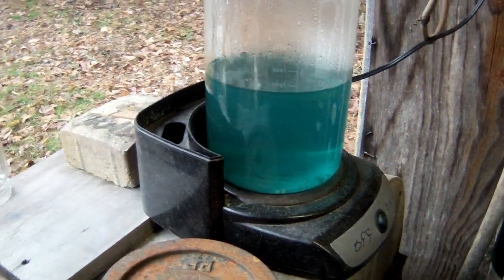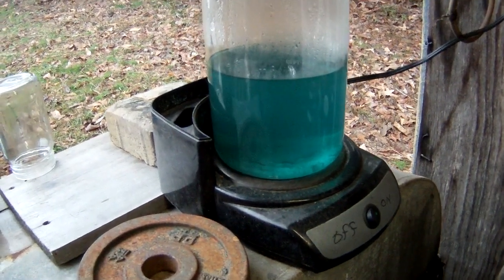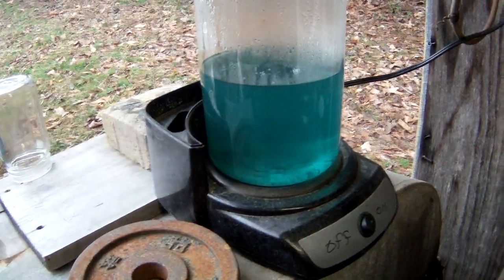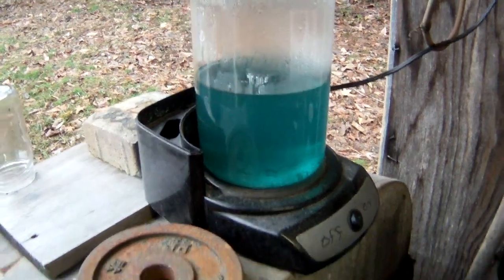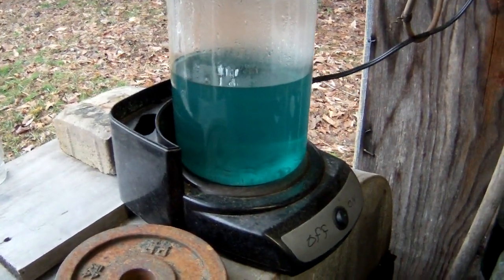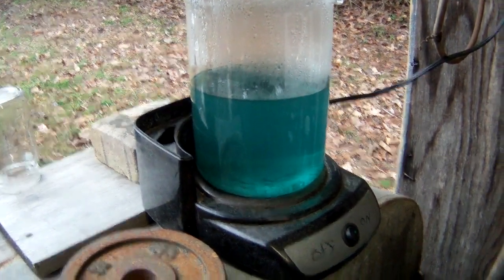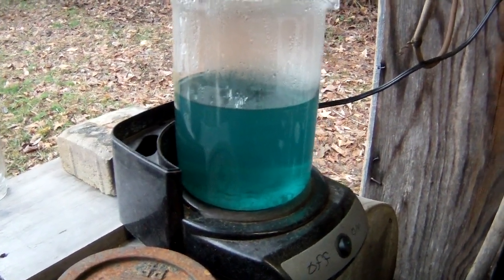It's the next morning, and as you can see, our reaction has stopped. We have just a tiny couple little pieces of silver left in there, which is just about exactly what we want — that way we know we used our nitric acid up and there's none left to de-nox. So we're going to go ahead and filter this batch off. I may save all these up into one batch and then just do one big drop. I just wanted to show you — this is batch one, it is completely dissolved. We have a nice-looking fluid, so we're going to filter that off and get our second batch going.